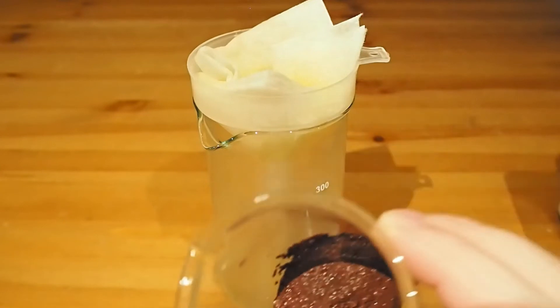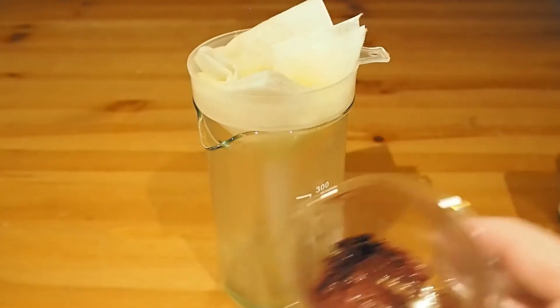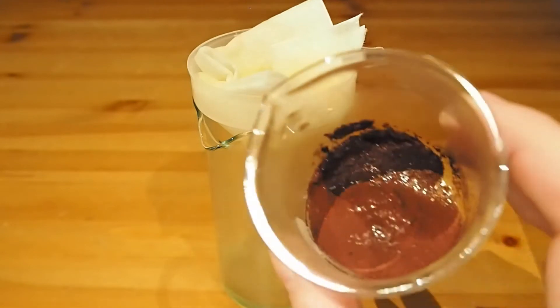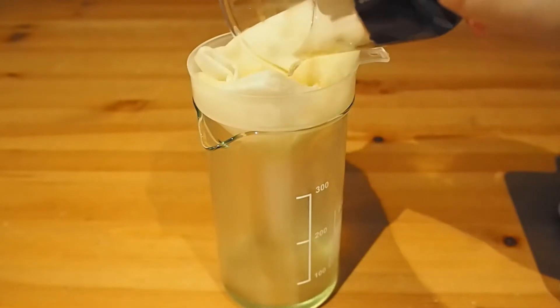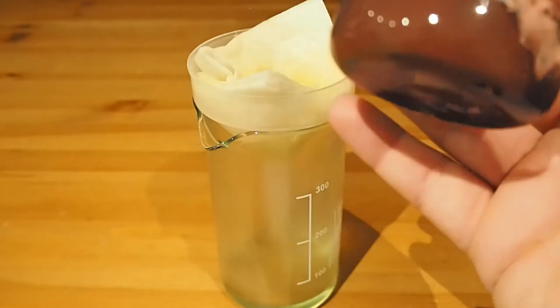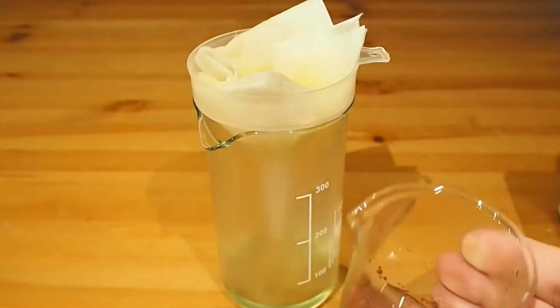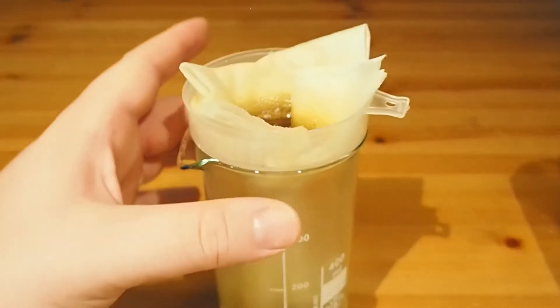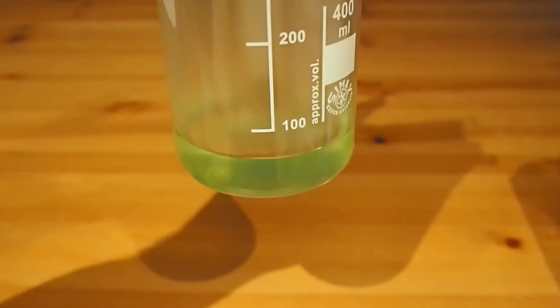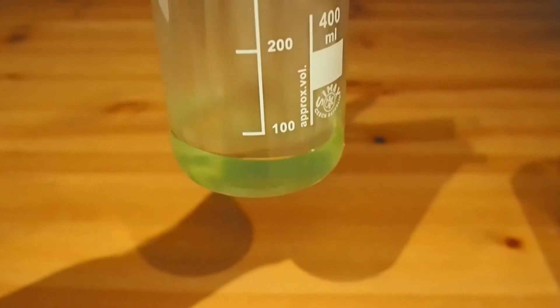You can see there — look at that. It's copper metal. Now what's interesting is it's actually plated onto often a lot of things like the iron, so it won't be just copper in there, but it looks very impressive, doesn't it, to go from that black through to some nice red colour. And there's our lovely green iron sulfate solution.